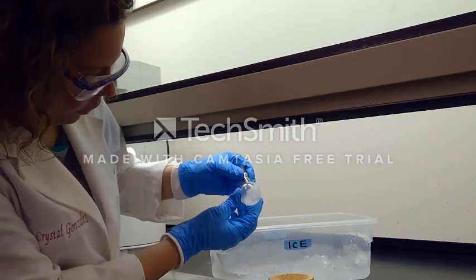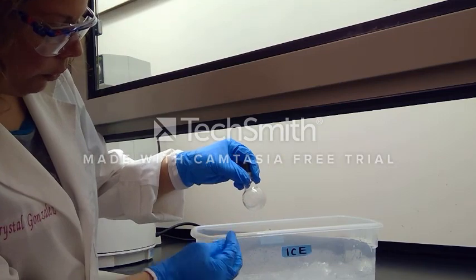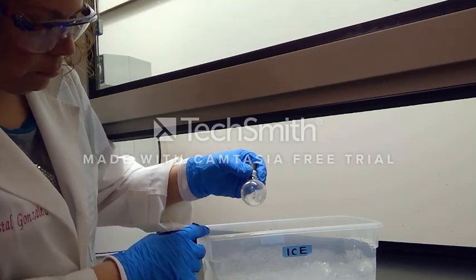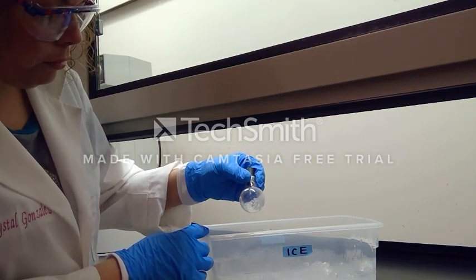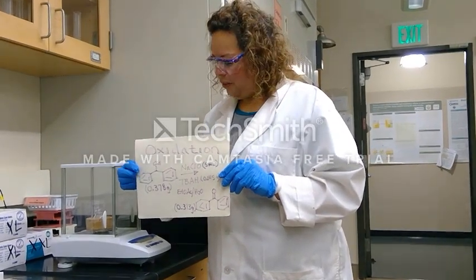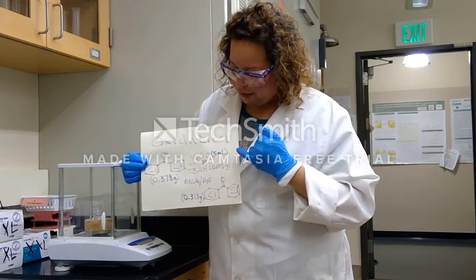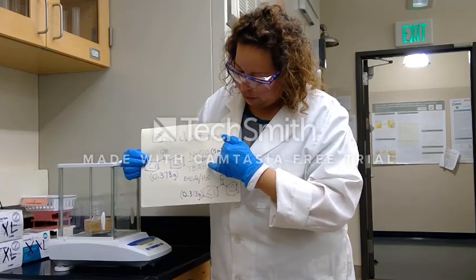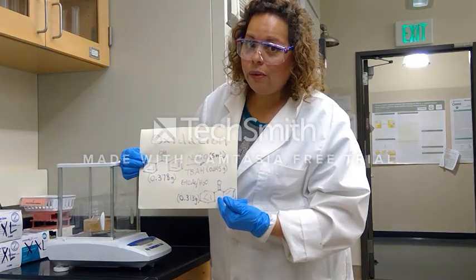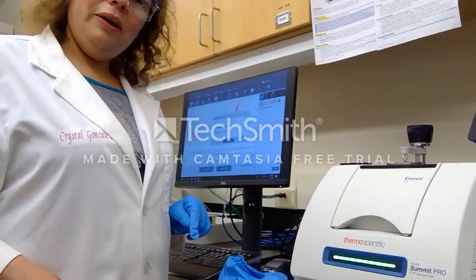We evaporated away our solvent, but because we had to turn up the rotavap temperature so high, we isolated an oil. We placed it in an ice bath and as you can see we now have crystalline solid forming at the bottom of the round bottom flask. To recap: we started with 0.378 grams of benzhydrol, used bleach as our oxidizing agent, tetrabutyl ammonium hydrogen sulfate as phase transfer catalyst, ethyl acetate and water as solvents, and isolated 0.313 grams of benzophenone.